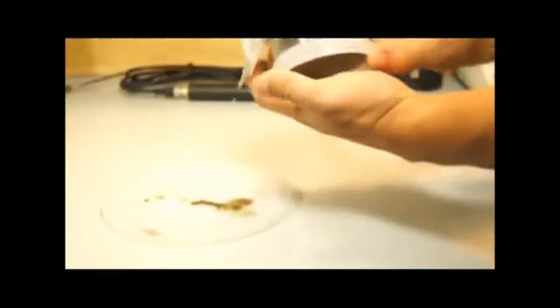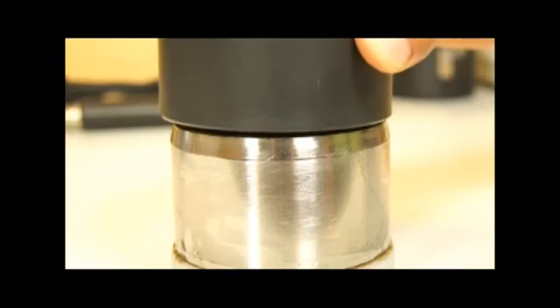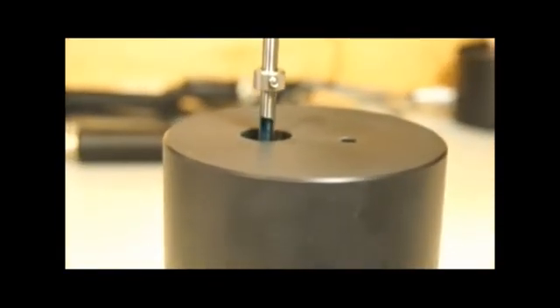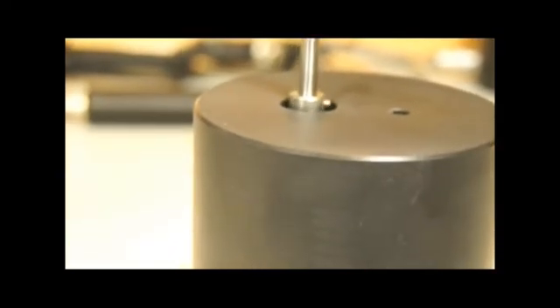Carefully flip the soil sample over and remove the cheesecloth. Mark tensiometer positions with the template. Use the auger to remove a core for each tensiometer, remembering which hole belongs to the taller tensiometer.